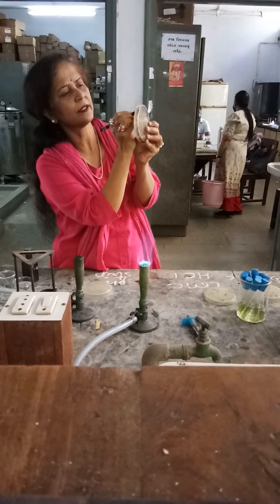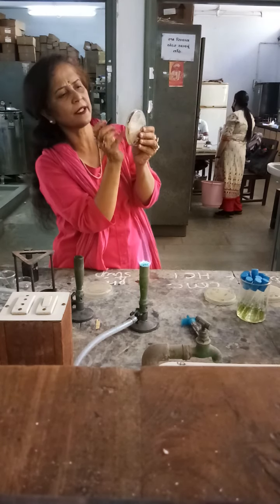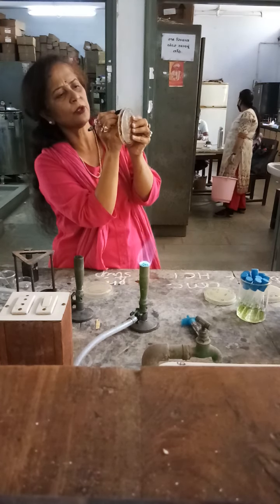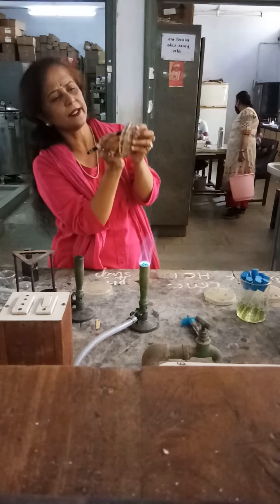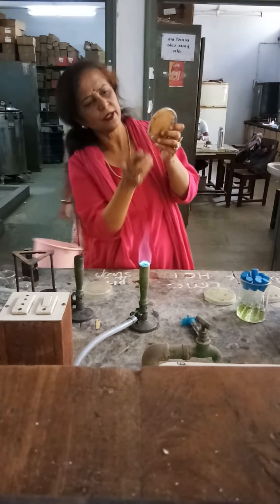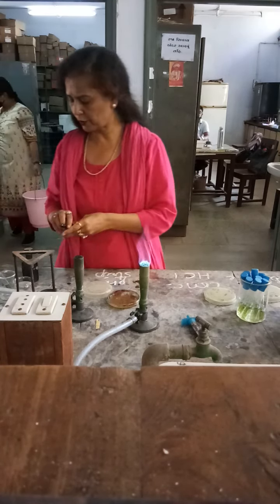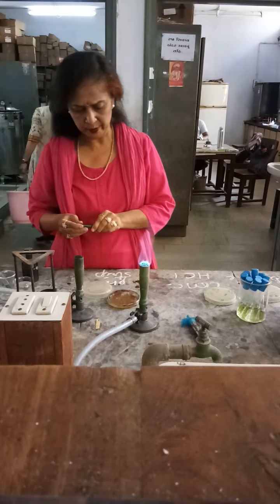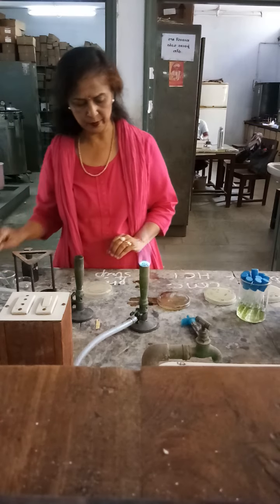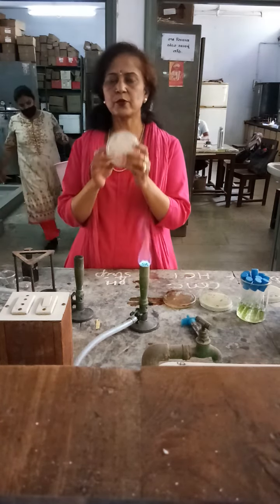Very clear and very nice colonies are visible. You can mark them, write down the colony characteristics, and then go for gram staining. You can also go for subculturing and preserve it in the form of a slant for secondary screening. That covers the starch agar plate and amylase-producing bacteria.